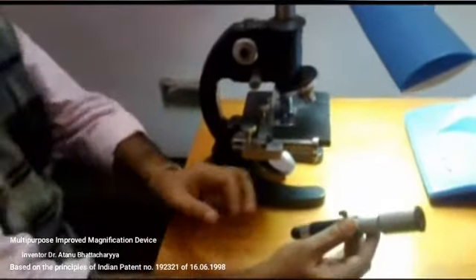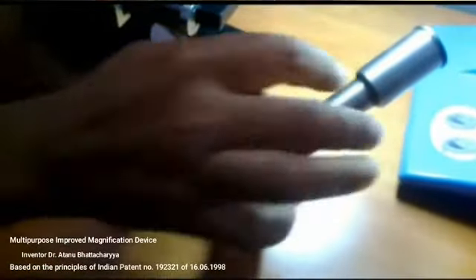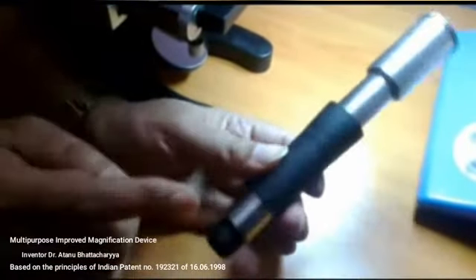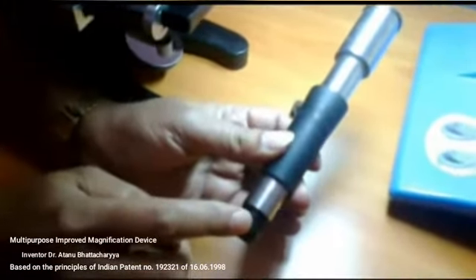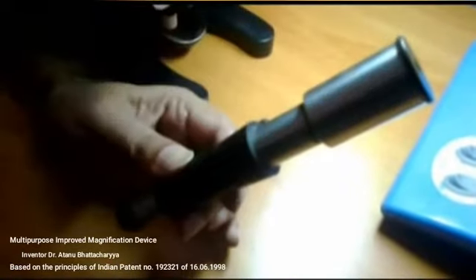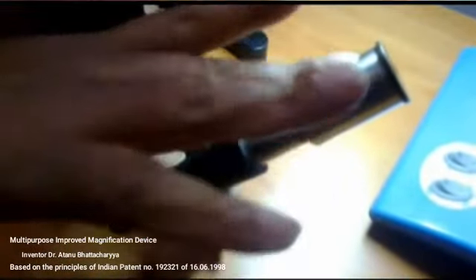It is the improved magnification device, a multi-purpose improved magnification device. It comprises two tubes. This stainless steel tube may be called the T1 tube and this black tube may be called the T2 tube. Below the T1 tube there is an objective. Actually this is the 4x objective, and above the T1 tube there is an eyepiece. It is a 10x eyepiece. So this tube itself may be called a microscope, which has a magnification power of 40x, that is 40 times magnification power.